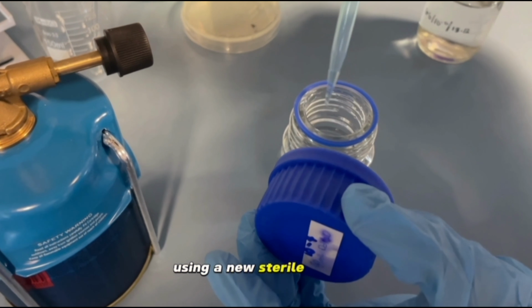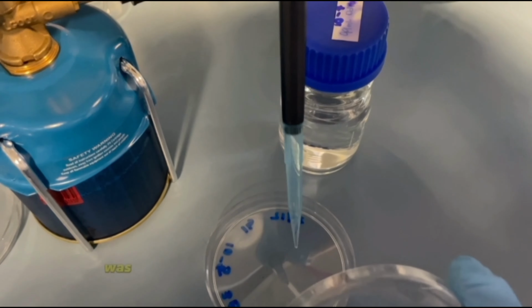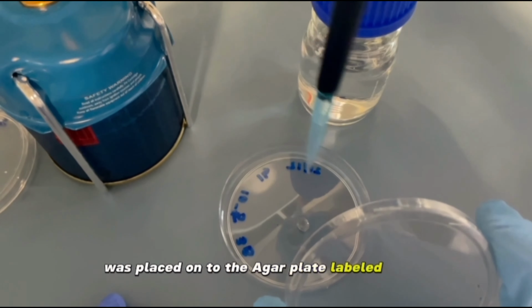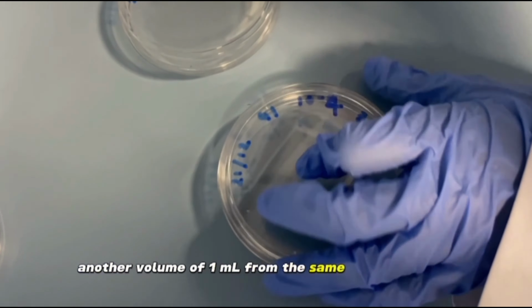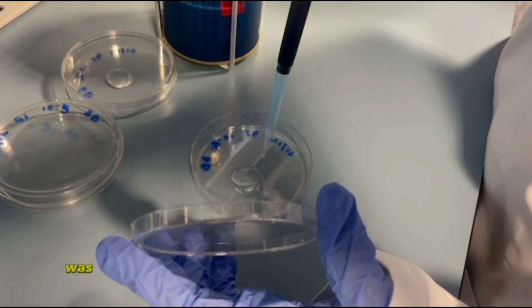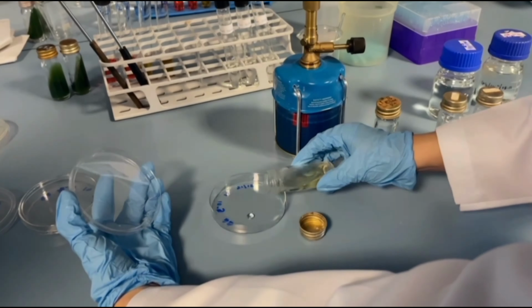From the 10^-4 dilution, 2 different volumes were aseptically transferred to specific agar plates. Using a new sterile pipette, 0.1 ml from the 10^-4 dilution was placed onto the agar plate labeled 10^-5. Another volume of 1 ml from the same dilution was transferred to a different agar plate labeled 10^-4.